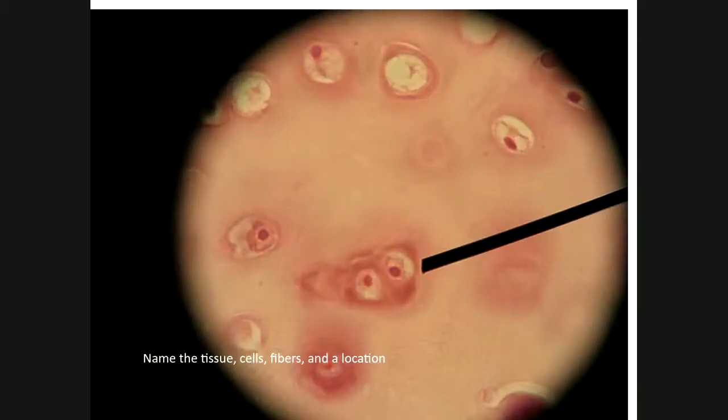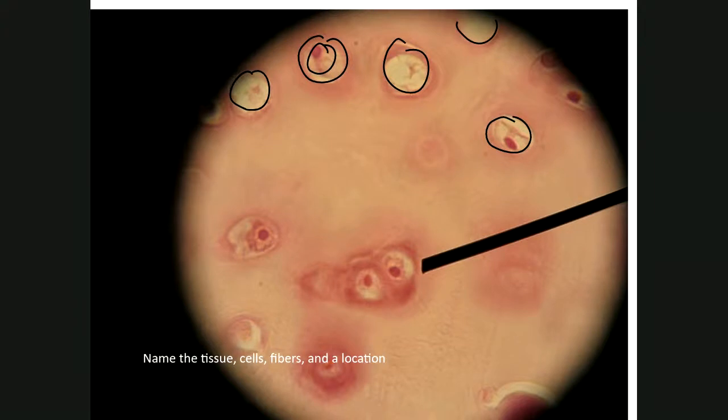Okay, next tissue. Okay, pinkish. All right, and it has spaces. All right, it has empty spaces and some spaces with actual cells inside. There you go, there's your lacunae. And sometimes the chondrocyte dies, leaving behind the lacunae only, which is what you see in the empty spaces. Another empty space, not empty space, but a little space with a little lacunae inside. That tells you this is cartilage.